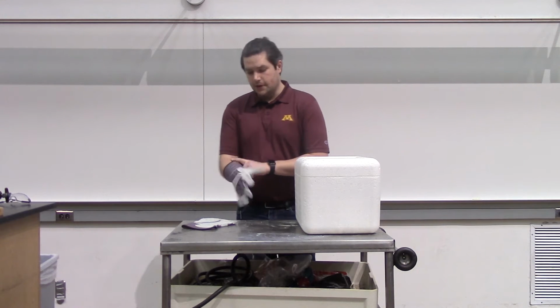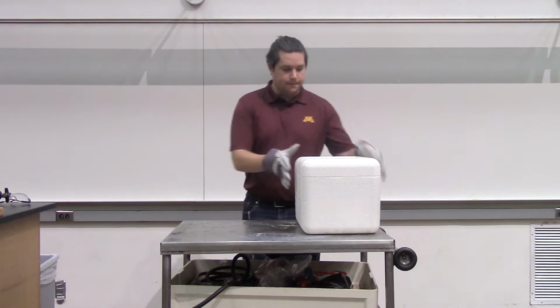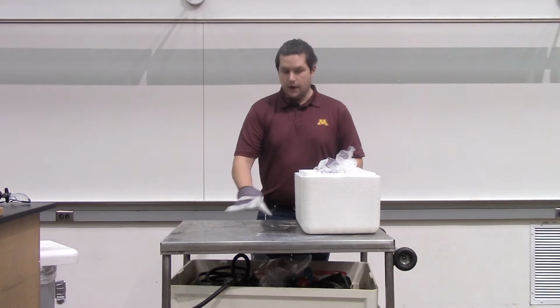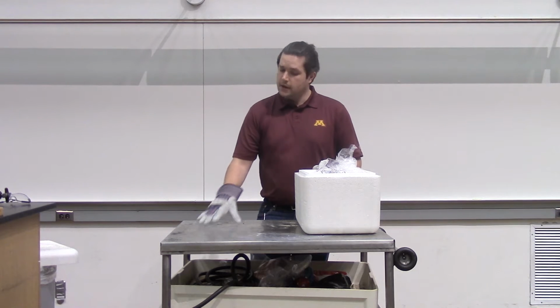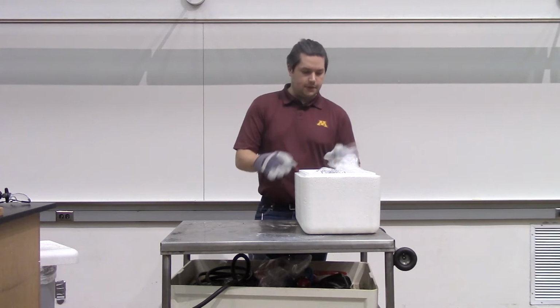To get started on this demo, I'm going to take these dry ice blocks out of a styrofoam container. And because we want them to have very flat faces, I'm going to put them face down on this metal cart. The ambient temperature from the room will actually cause this dry ice to sublime, slowly flattening it out the way that you might think of sculpting ice with a hot knife or something like that.